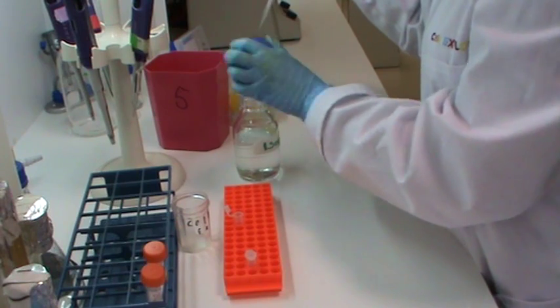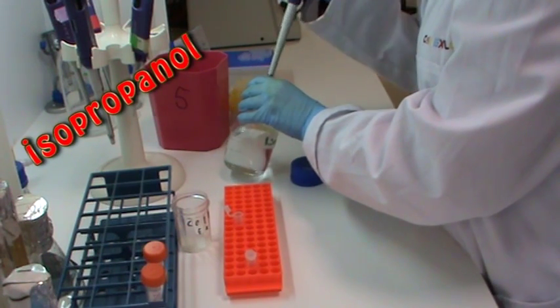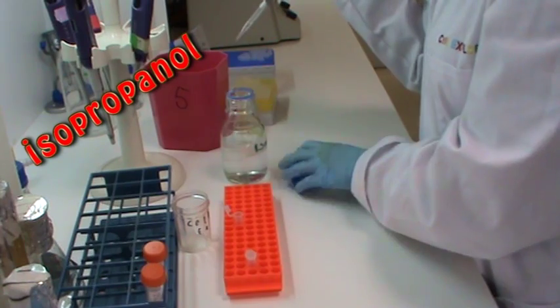Next I am adding isopropanol. This will cause the DNA in the solution to aggregate and precipitate out.